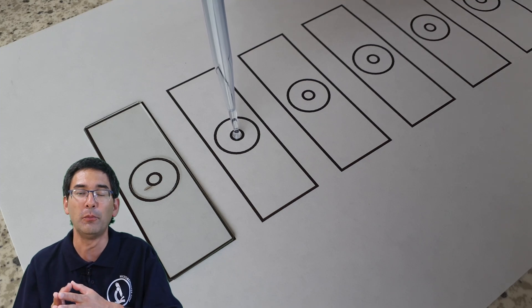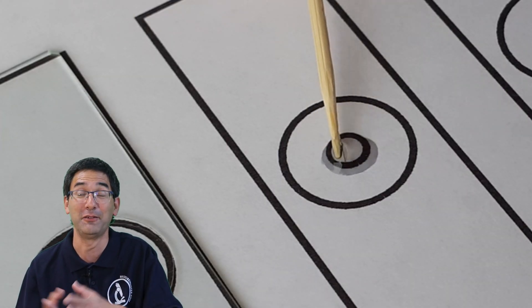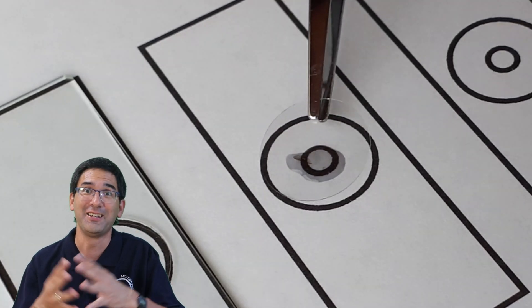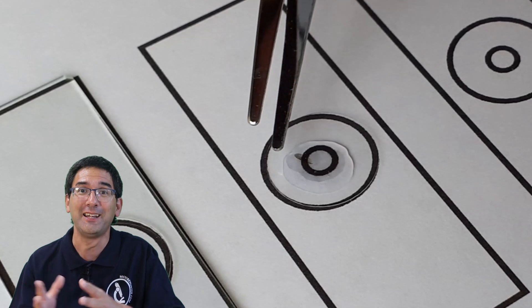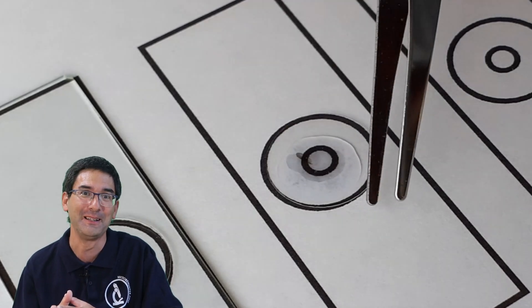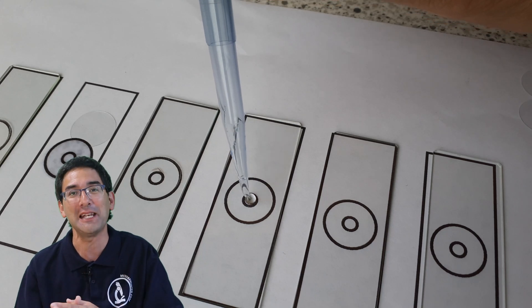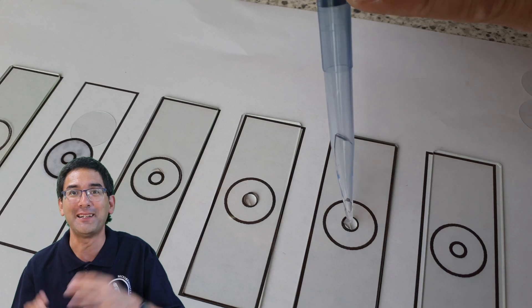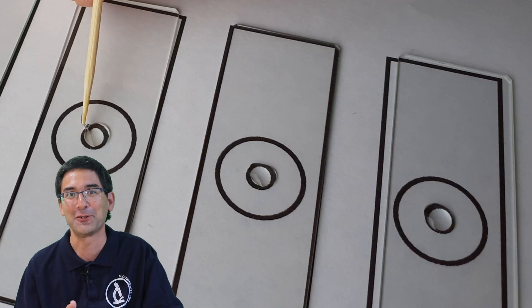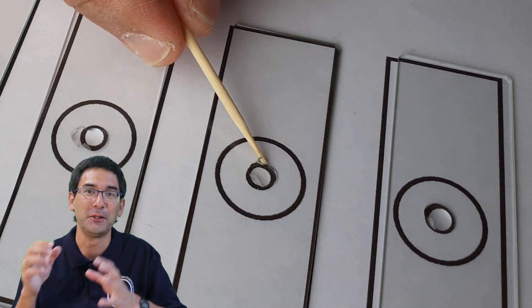On the second one I put some mounting medium on top and then I realized something — did you see it? I could not believe it myself, I was just screaming out loud. I forgot to put a slide on top of the paper template — I simply mounted it directly on the paper! Luckily I was able to save the wing, but as you can see, my eyesight is already so bad that I did not even notice I'd forgotten the microscope slide.